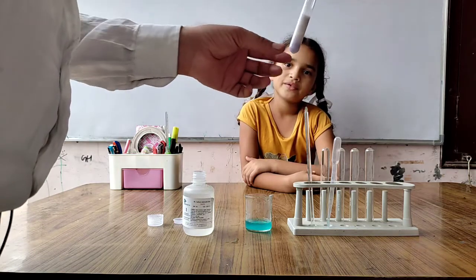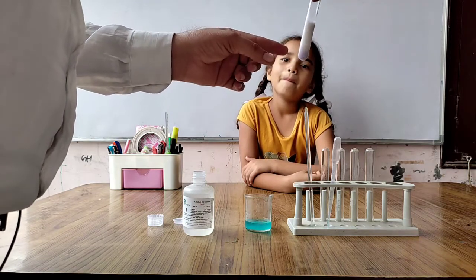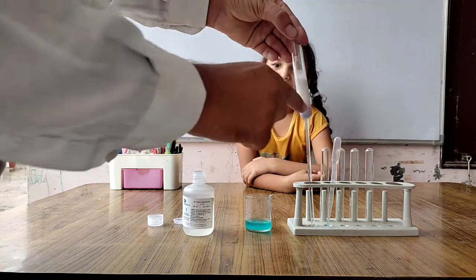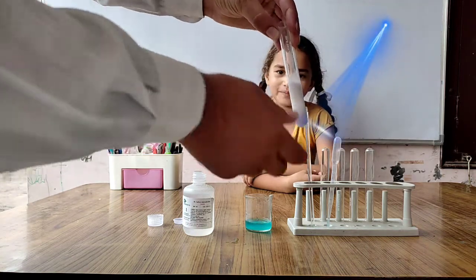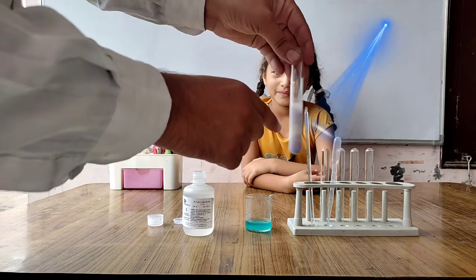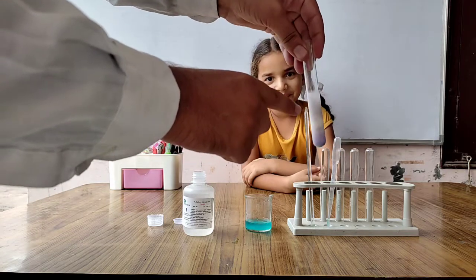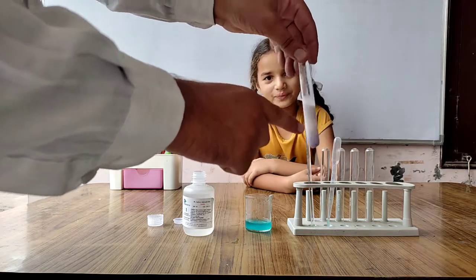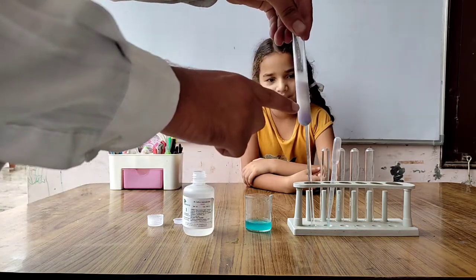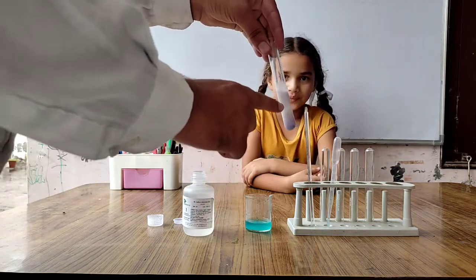So students, what is the color of the milk now you are observing? Purple. The color is turning purple — bangni. Purple color shows that protein is present in the milk.